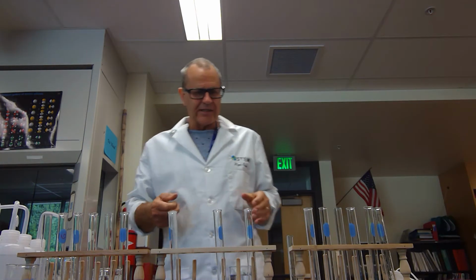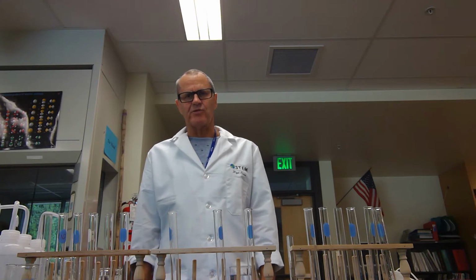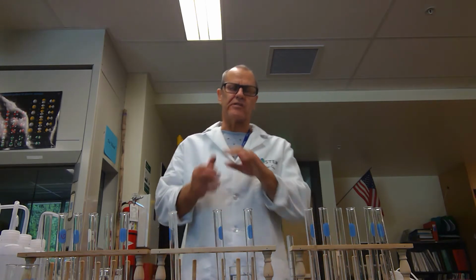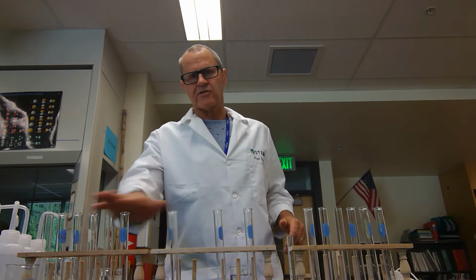Alright, so I'm back and I'm going to do the serial dilution. And you know what dilution is. Serial is not Cheerios and stuff you have in the morning. Serial is S-E-R-I-A-L, to show that there's a series of stuff going on. And we're going to make a series across here, and we're going to make a series across here.